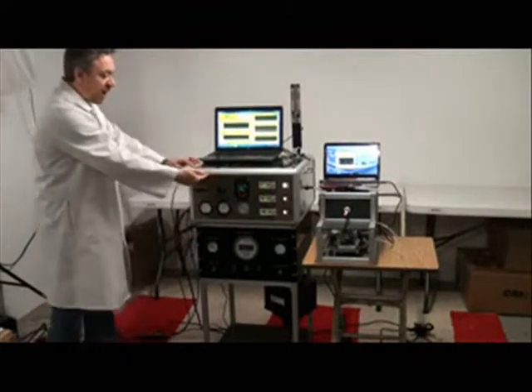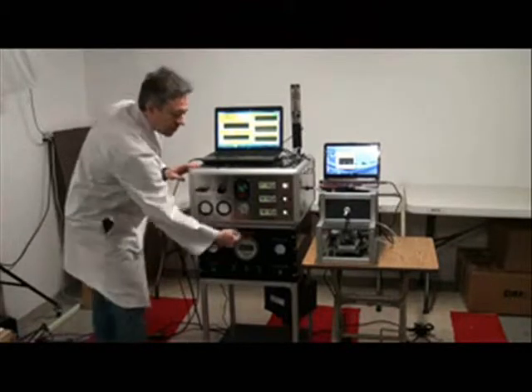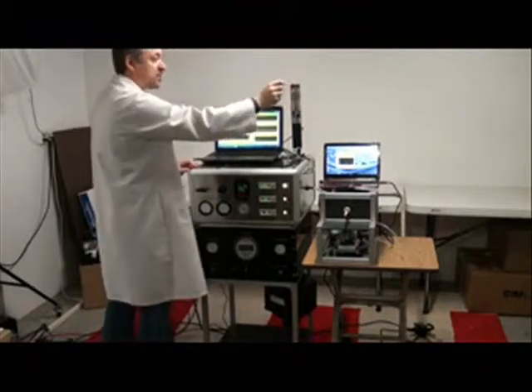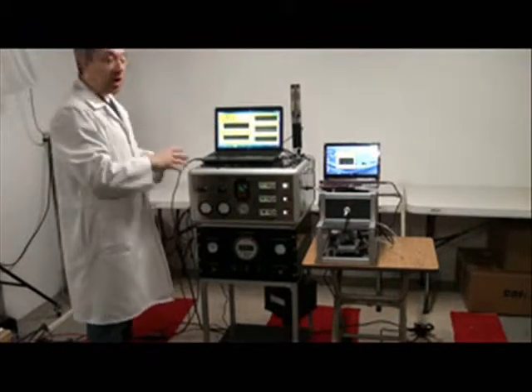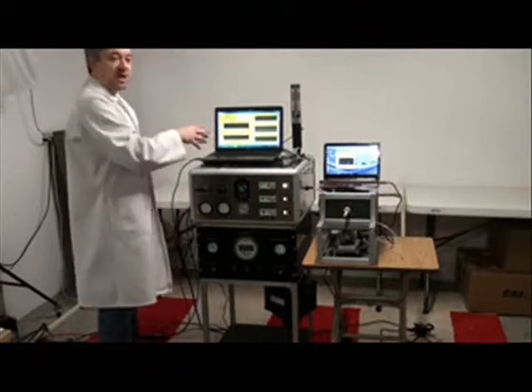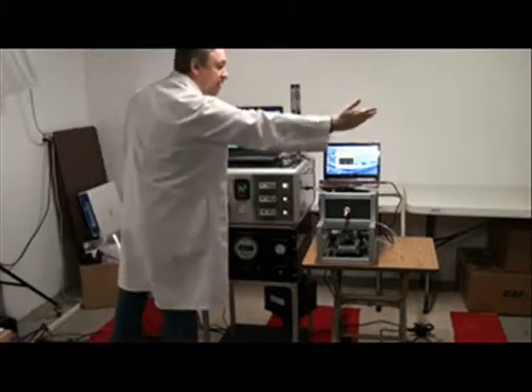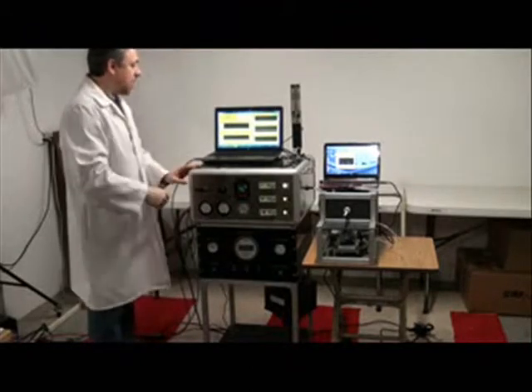So the mainstream smoke now comes through the siphon, goes into the mixer, mixes with side stream, and goes to the inhalation chamber, and there the aerosol monitor measures the concentration, which is then compared to the set concentration in the software. Obviously, in this latter case, the control loop of the mass flow control will be different, so the PID values will be adjusted to account for the length of the sampling line from the inhalation chamber.